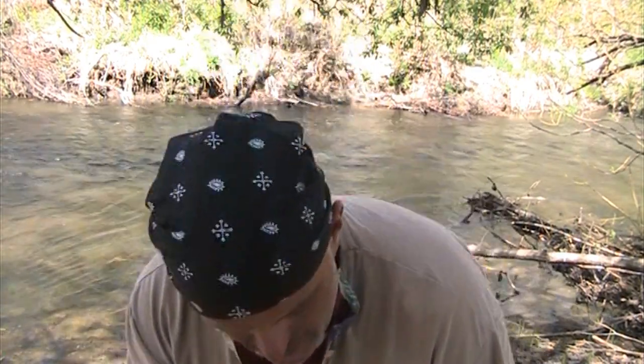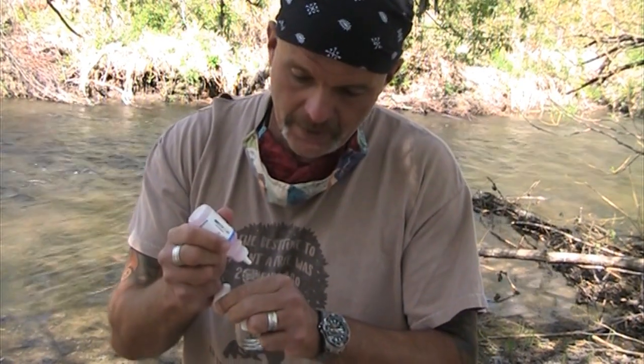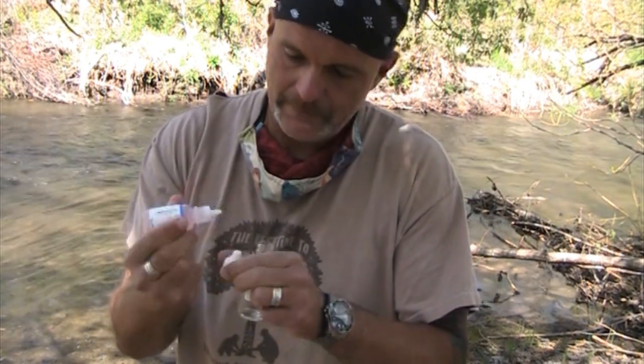So the first chemical I'm going to add, just double checking the direction, is the manganese sulfate solution. There's your manganese sulfate. I'm going to add 8 drops. When your students do this, and if you're a student, you need to do this, got to count it out. 1, 2, 3, 4, 5, 6, 7, 8.